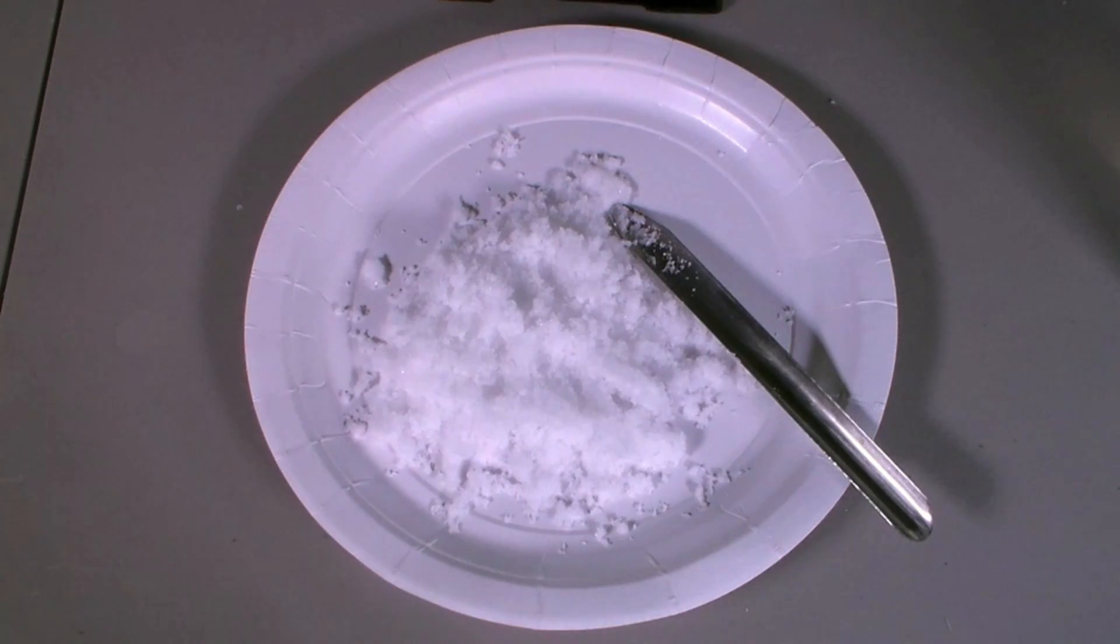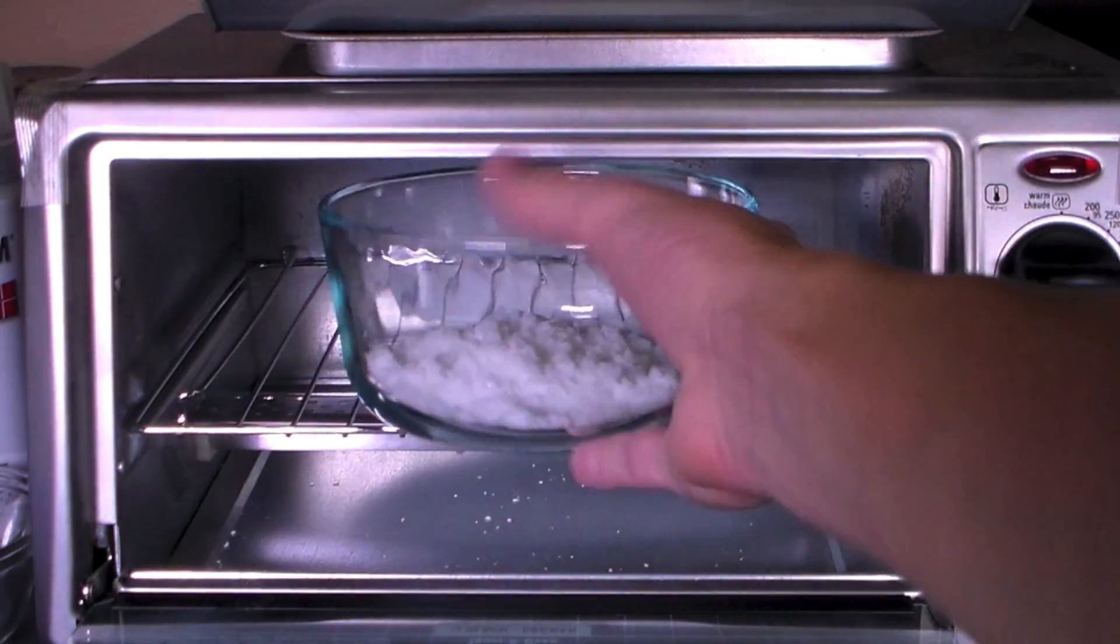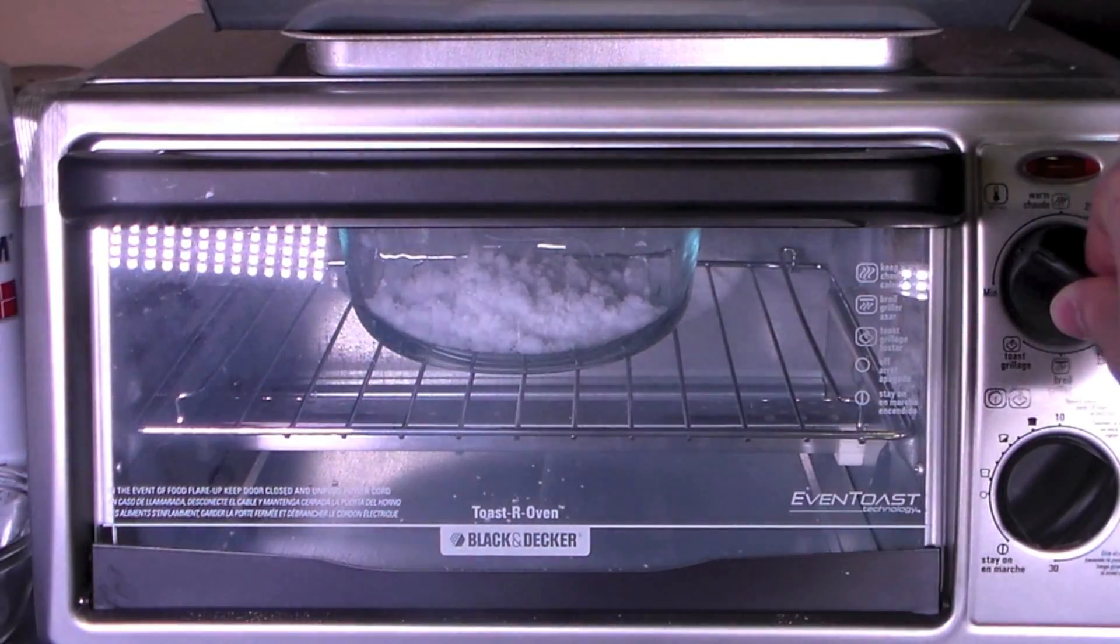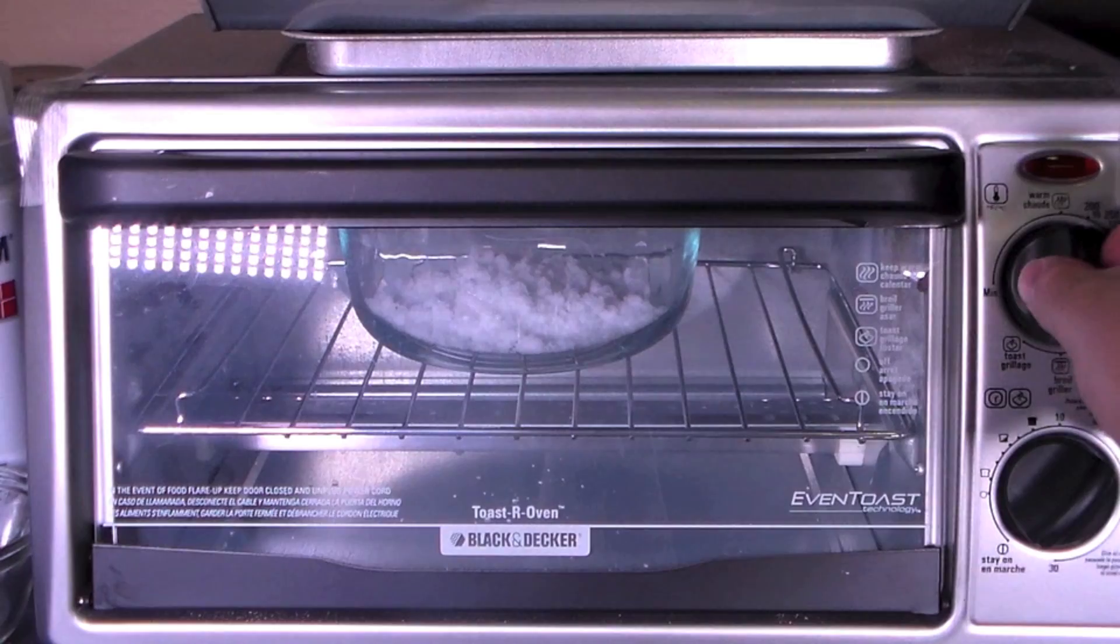After the washes, you can either leave your crystals on a paper plate to dry or you can dry them in an oven. Just make sure not to heat it above 170 degrees Celsius as boric acid decomposes at that temperature.